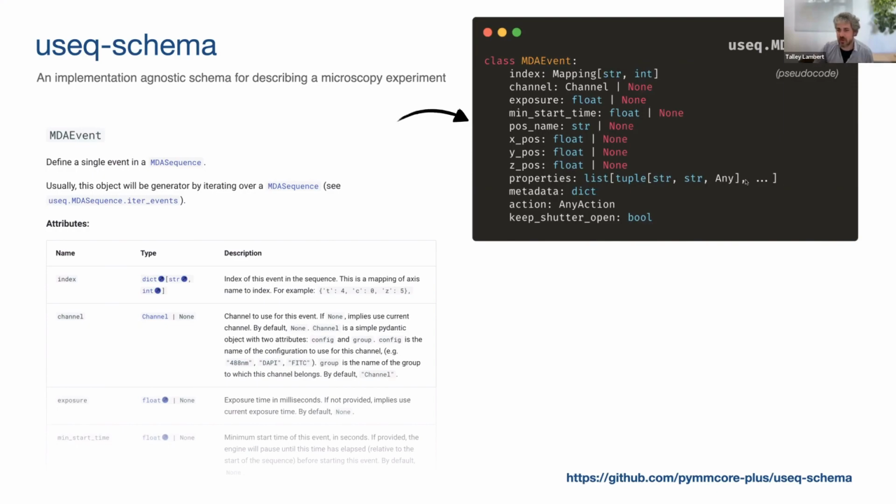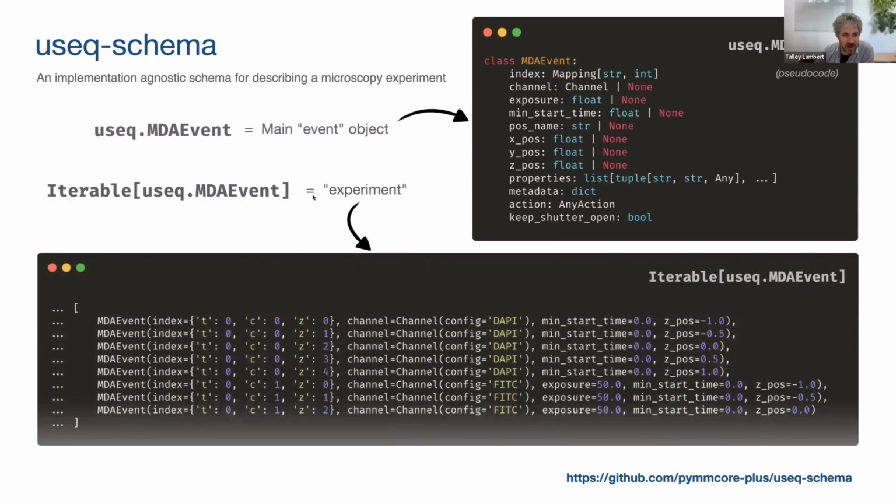Properties is also a list of property or device label, property label, property values. So it's also kind of a key value pair. That one is really geared towards Micromanager, but the assumption is that most things in some way have a label with a device name and some property name and some property value. Maybe it won't be useful in the long run, but that's there. Metadata is the truly customizable spot. So each event now is captured by this kind of object.